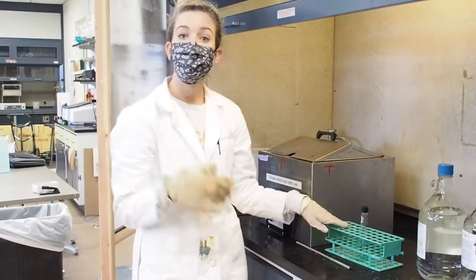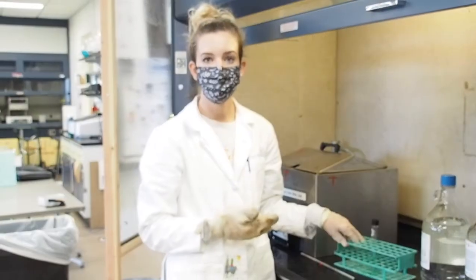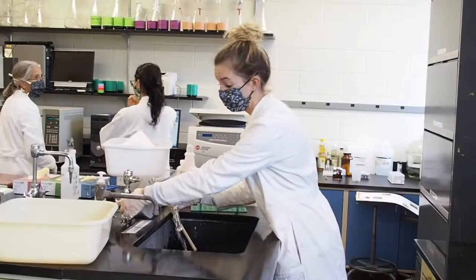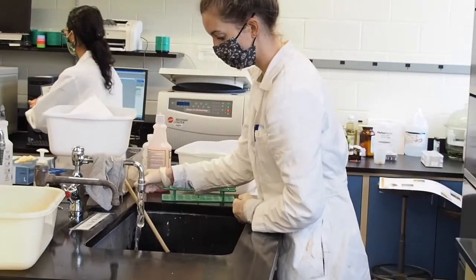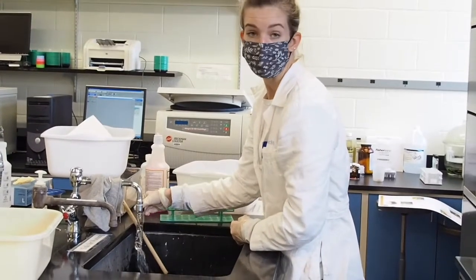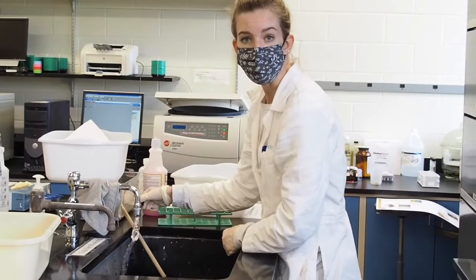Now I'm going to take it over to the sink, and we're going to rinse it again with the warm and then cold water, so that we can bring down the temperature of our tube before we move on to the next. So again, I'm just starting with warm water and then moving over to cold water to rinse my tube, and I'm going up and down to make sure that I'm getting it all cooled off. And I will again test it on the back of my hand to make sure it is at room temperature before I move on to the next.